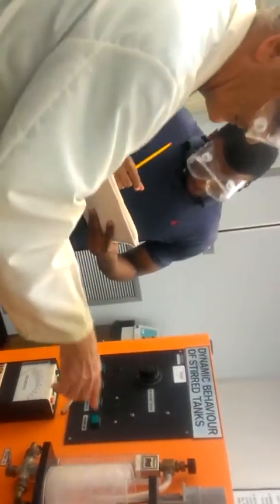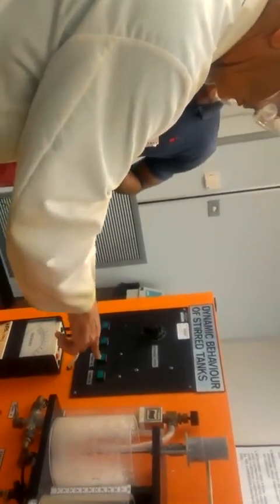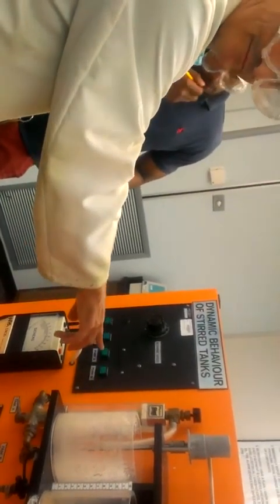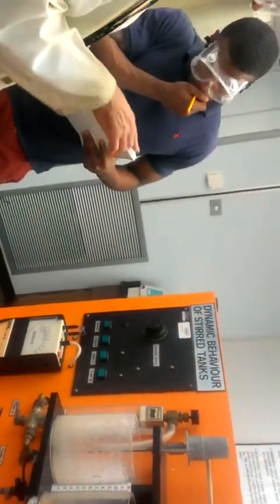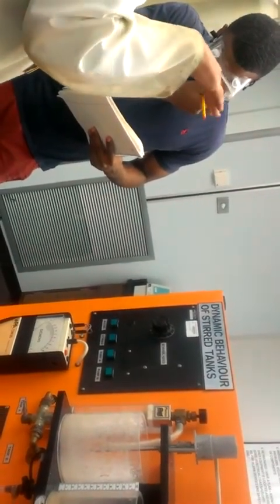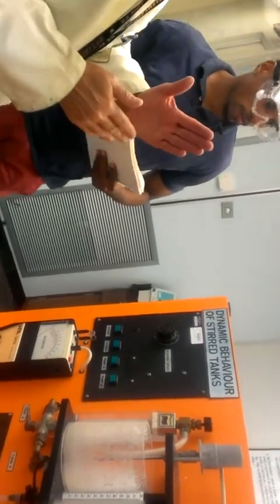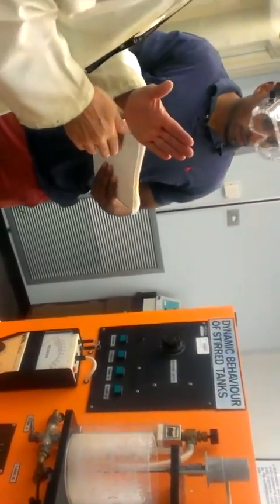So you keep going, after the 20 seconds the salt off, and the other on. And then you will see how the real pulse looks. Not going to be symmetric at all. It will start later, with a long tail.